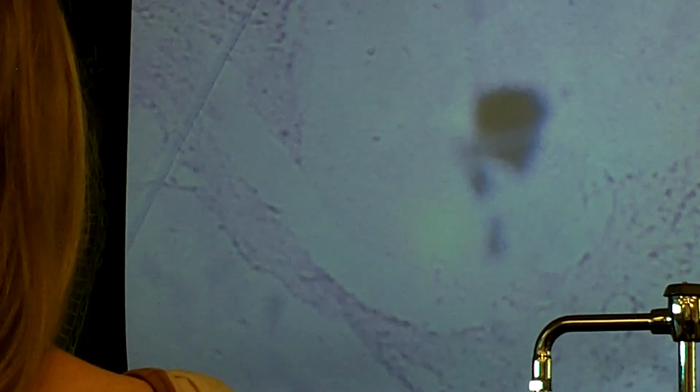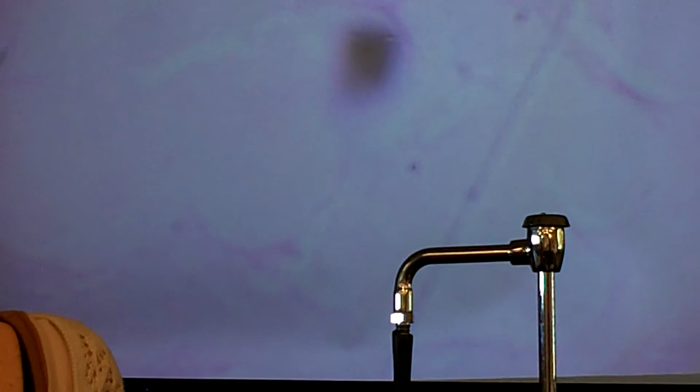But again, what I would do is just focus on low power. Be able to see something like this under low power. Be able to take a look around and say, okay, this is an ovary. A little puffy white cloud in the ovary. That's the big corpus albicans. So that would be a testable view right there. Any questions on the ovaries?